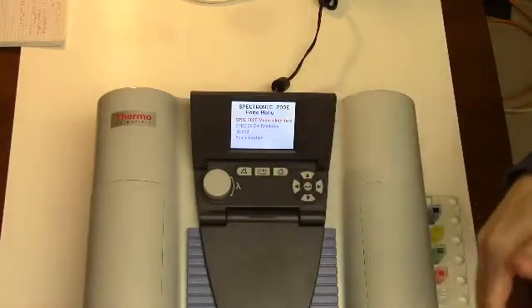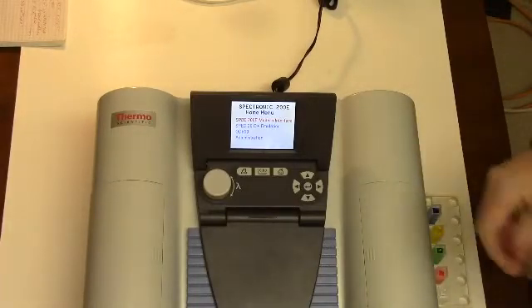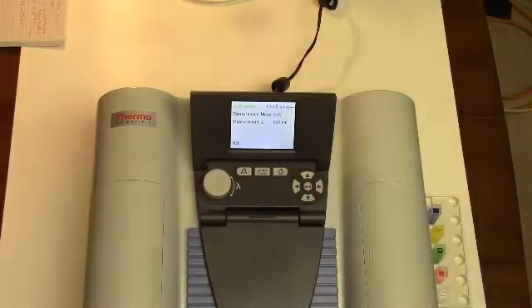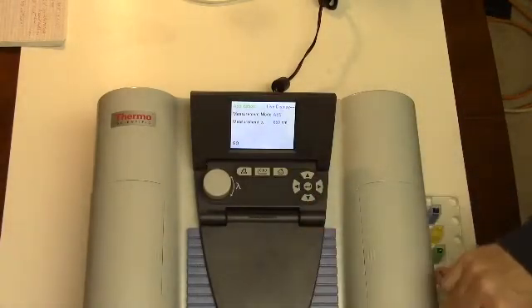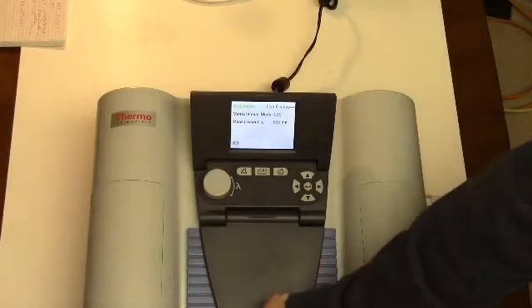This one can actually scan over a variety of different wavelengths as it scans. So like I said, we're going to use this first setup here, and that's everything that you'll see me doing down here is just putting some stuff into the sample compartment.